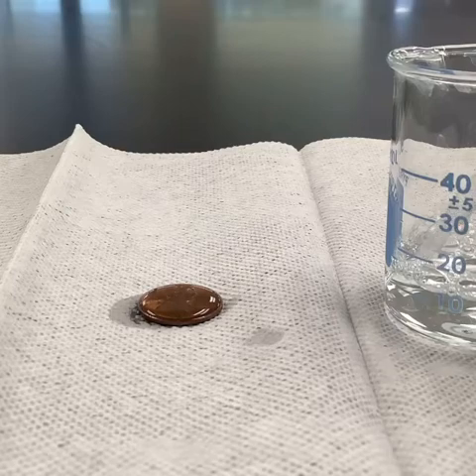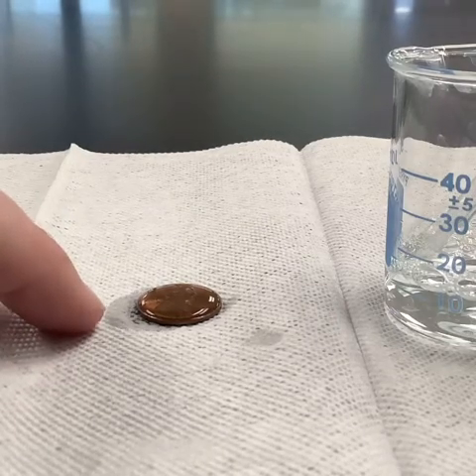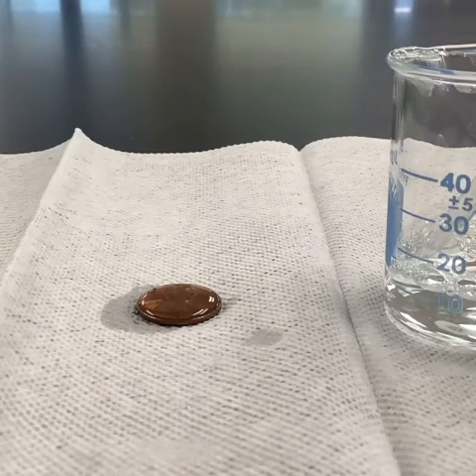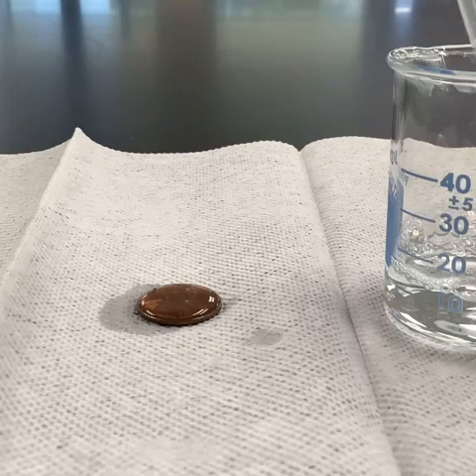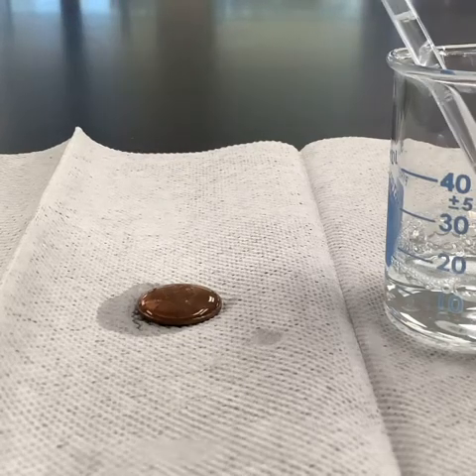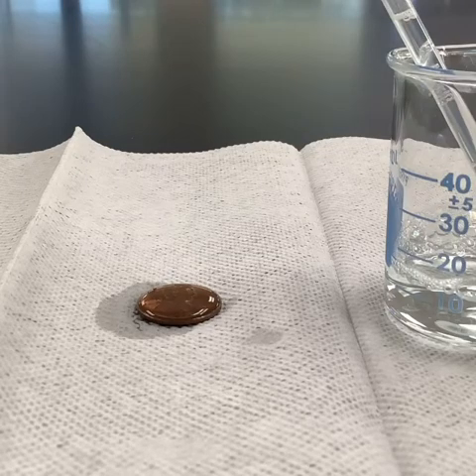Looks like it's starting to fall off now. I see those last couple of drops, they weren't sticking. Every time it hit, it falls off. So we'll stop there. But we'll see if we put another one on, it should just slide right off. Yep, just sliding off. So it's not holding anymore. That's all it'll hold. Okay.